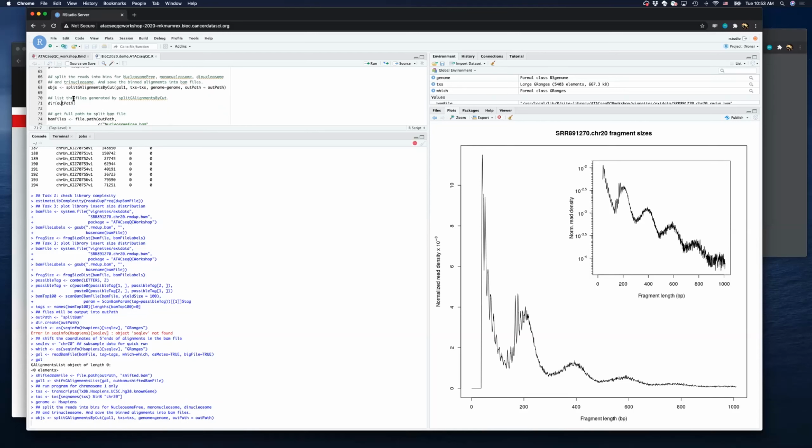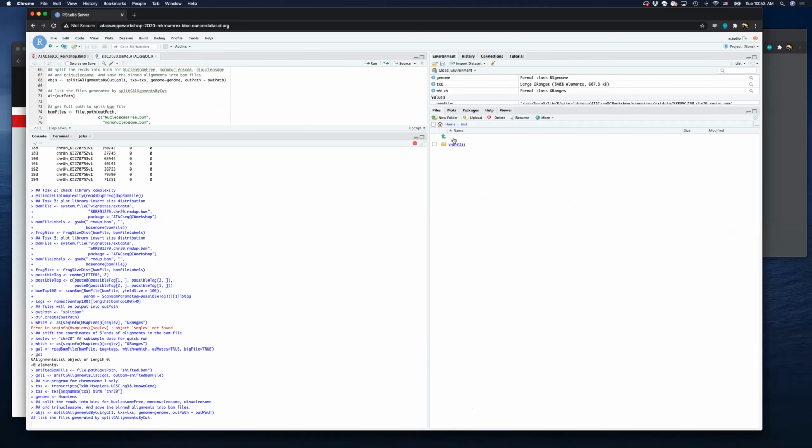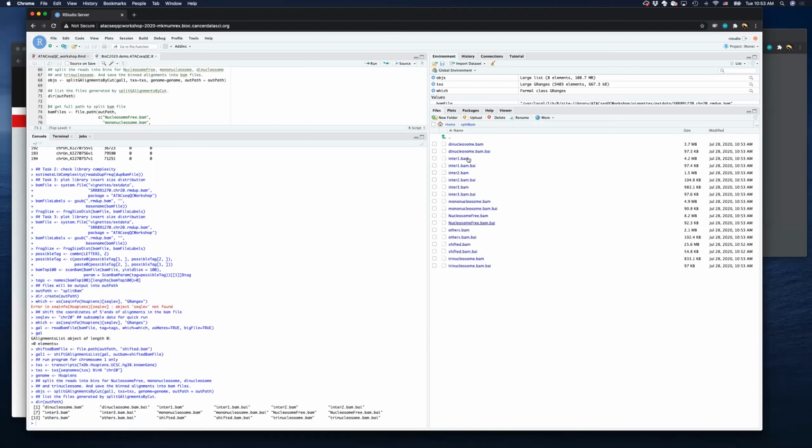After that, we can check the output files. It will contain a lot of information. You can see the split BAM file folder contains a lot of them. For example, the dinucleosome BAM, the mononucleosome file, and the nucleosome-free file. All of these can be used for downstream analysis. Also, some reads have a length between, for example, nucleosome-free and mononucleosome. Okay.